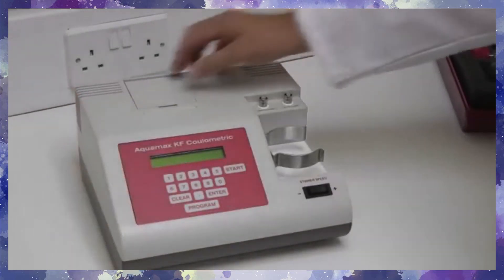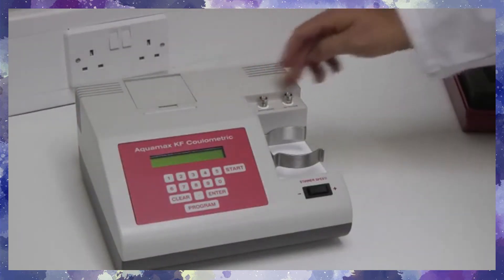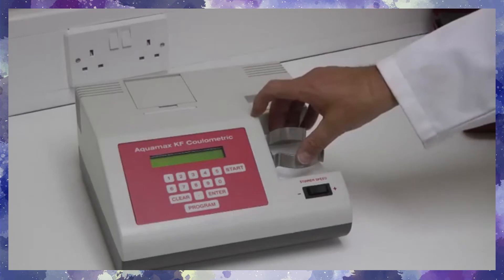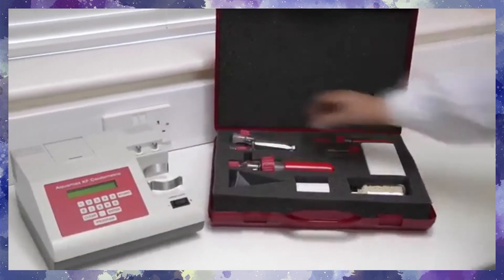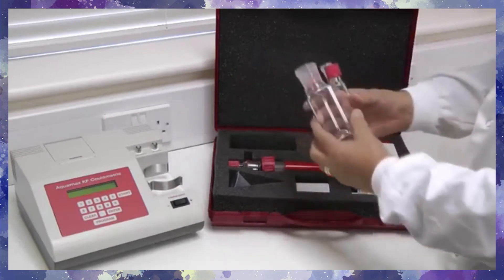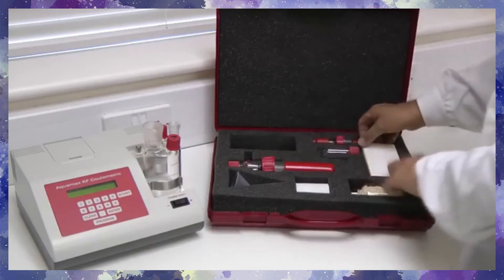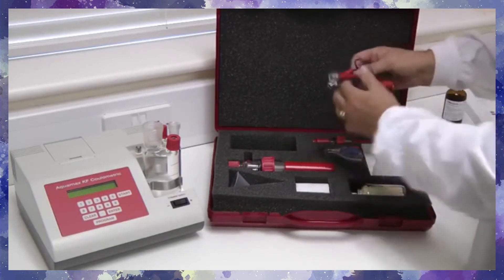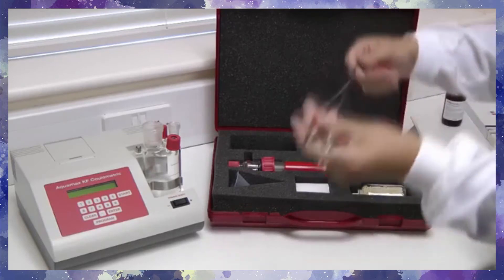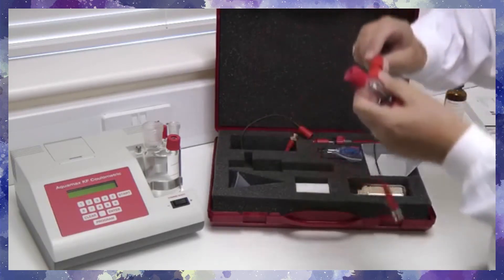At the top and front are the printer, connections for the electrodes, the titration vessel holder, and the front panel. To assemble the glassware, start by placing the titration vessel in the holder. Next, take the electrode leads and attach them to the generator and detector electrodes, and then locate the electrodes on the titration vessel.